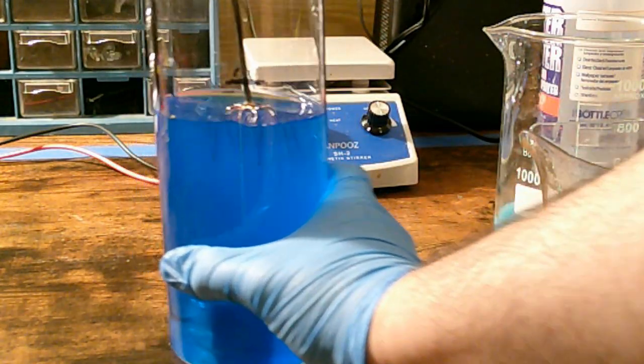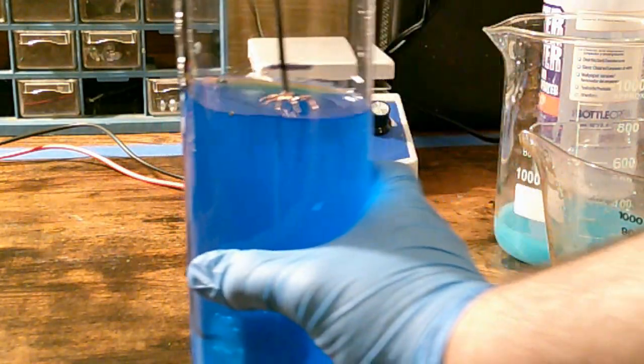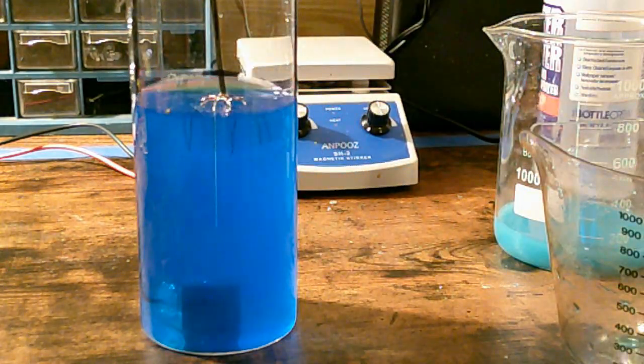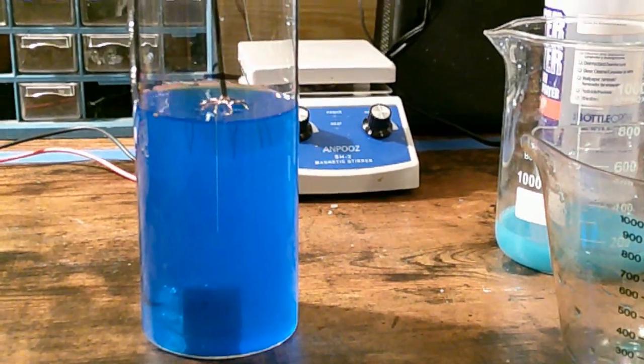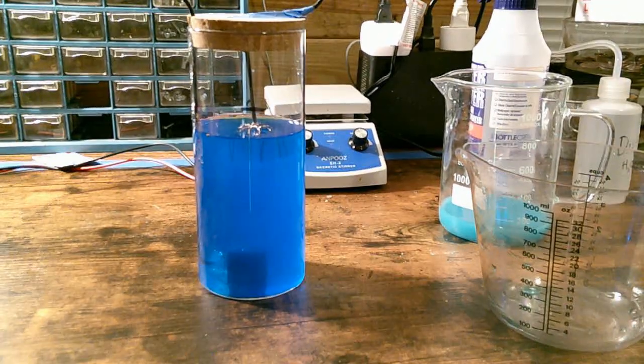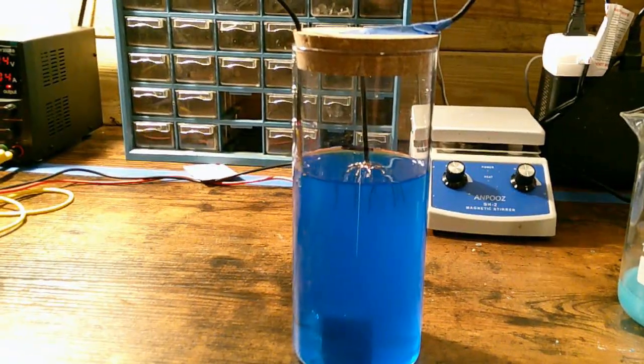So there is the setup. I'll drag this back a little bit.